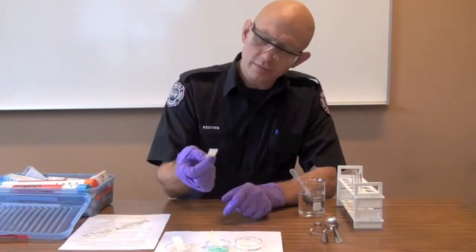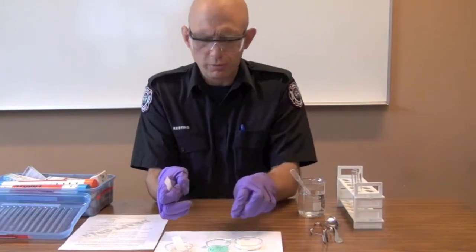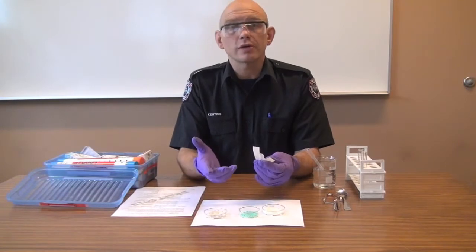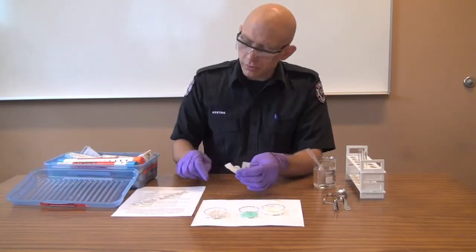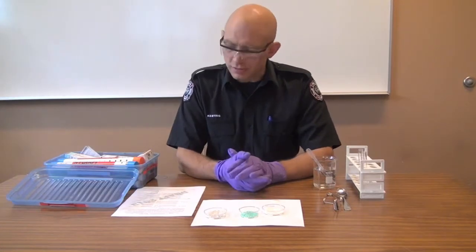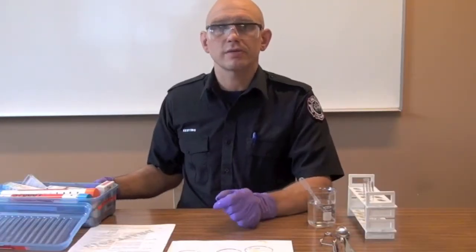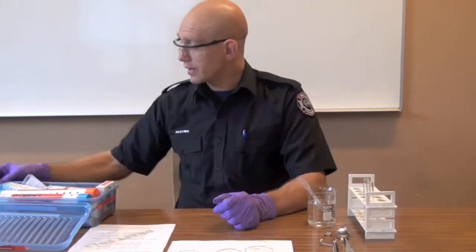A minute's gone by and we're taking a look at these strips. As you can see, there's no color change except for the green that's been added — it hasn't turned blue or black. Turning blue or black is a sign of an oxidizer. This is worth noting because not every test will reveal every class of compounds. This test will not reveal nitrates and peroxides — both of which are oxidizers — and that's why it says so on the sheet. Note that sometimes the color change is temporary; any black or blue color indicates an oxidizer. Also, this test will not detect nitrates and some peroxides. If there was a type of oxidizer the strip could detect, part or all of it would turn black — like this — and that's a dead giveaway that you do, in fact, have an oxidizer.